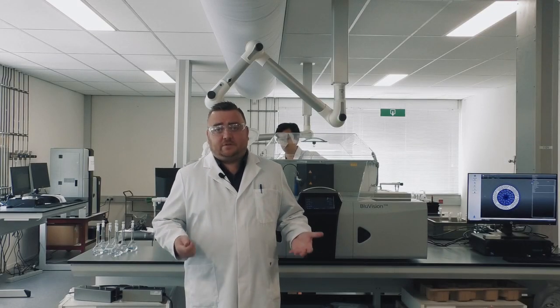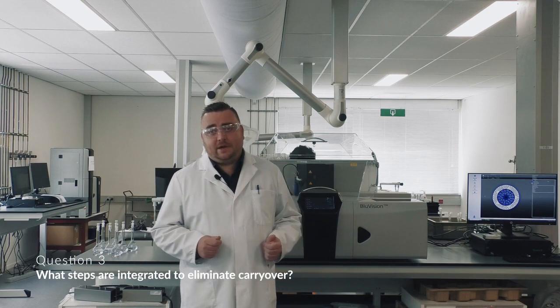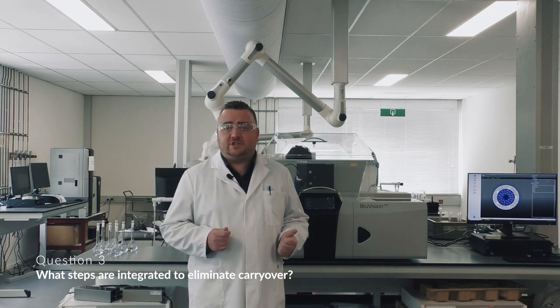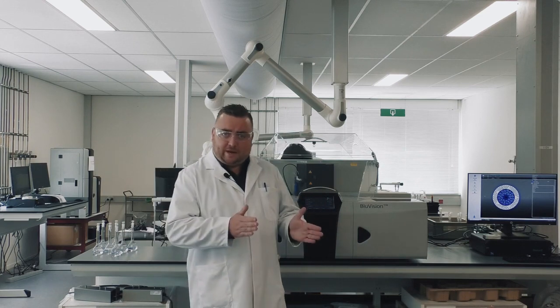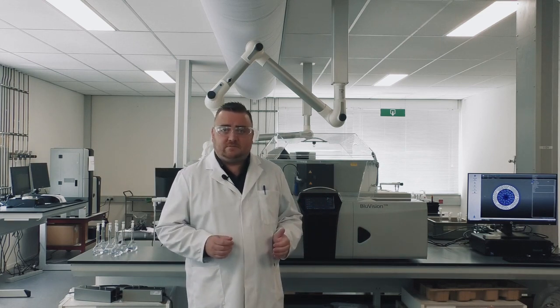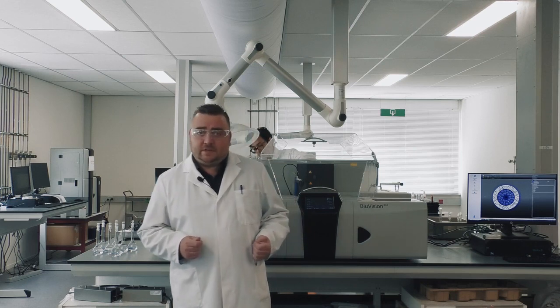So question number 3 is related to carryover and the steps we have integrated to minimize or even eliminate carryover between high and low range samples. So this is basically a 3-part answer. The first being that naturally between every step the analyzer takes, there is a very robust washing step, a rinsing step for both the inside and the outside of the needle.